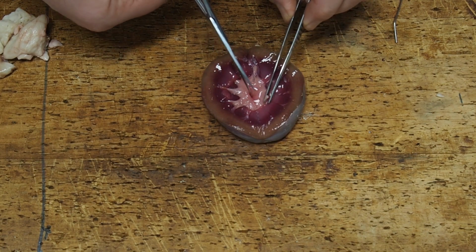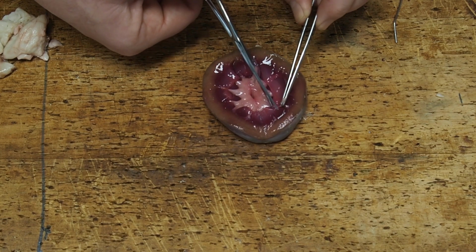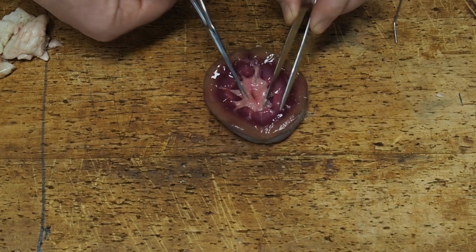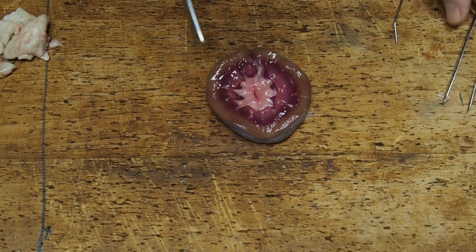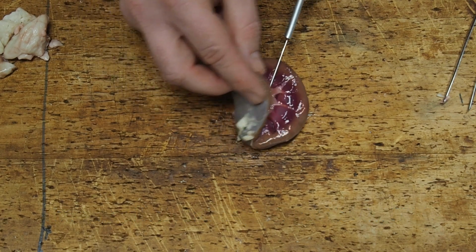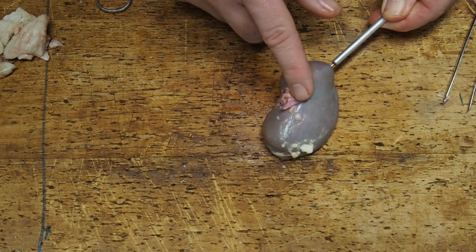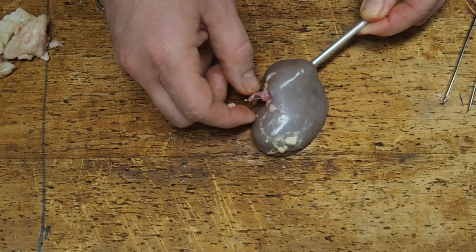Just continuing to clear away bits of medulla here, so you can see those white calyces pointing up from the pelvis and the pink medulla pyramids pointing down the other way. Those pyramids are made up of many thousands of tiny tubes, and urine flows down those tubes in towards the centre, and eventually it goes out through this hole, which is the opening to the ureter, which is the tube that leads to the bladder. So it comes out the other side, and you can see what's left of it here. It hasn't survived being removed from the sheep very well.